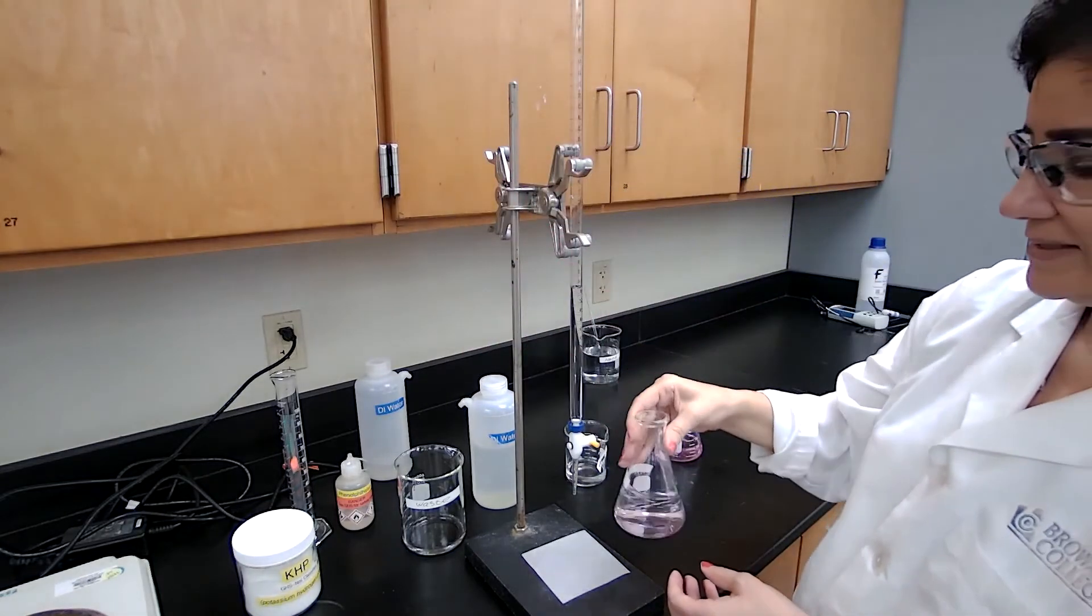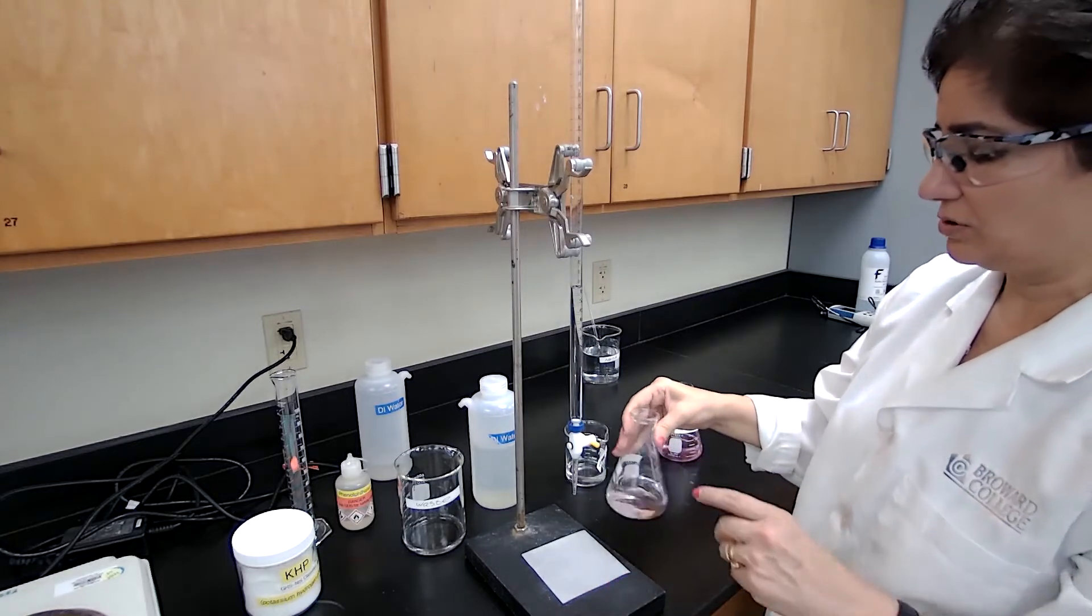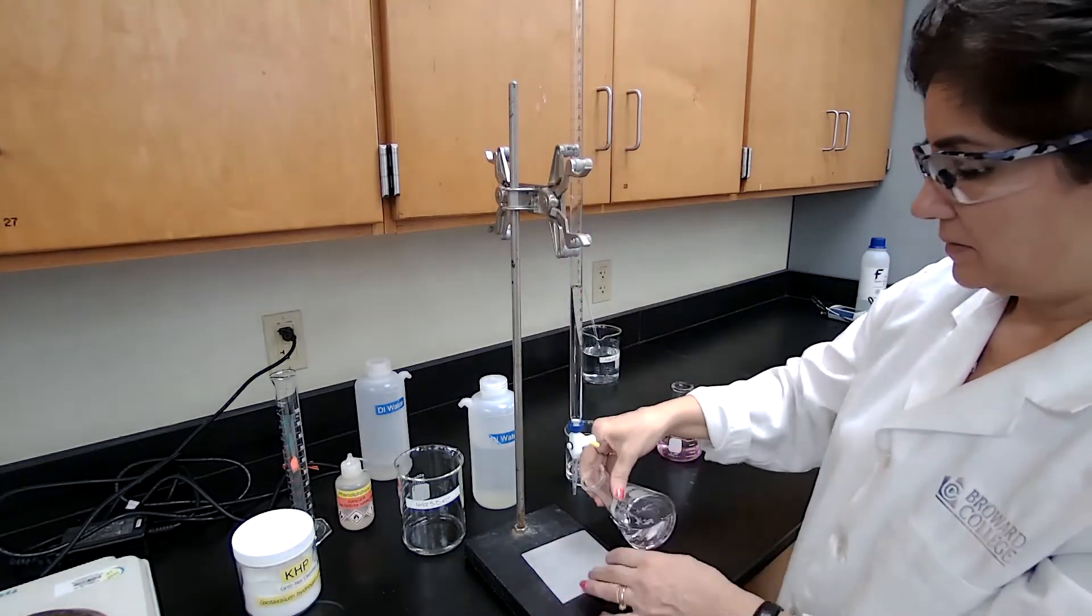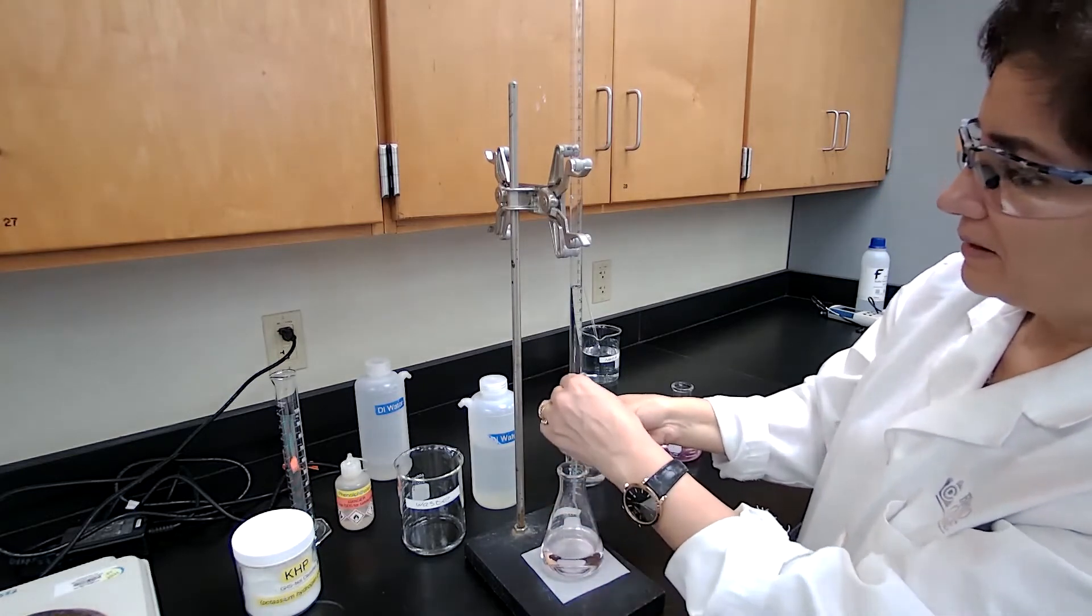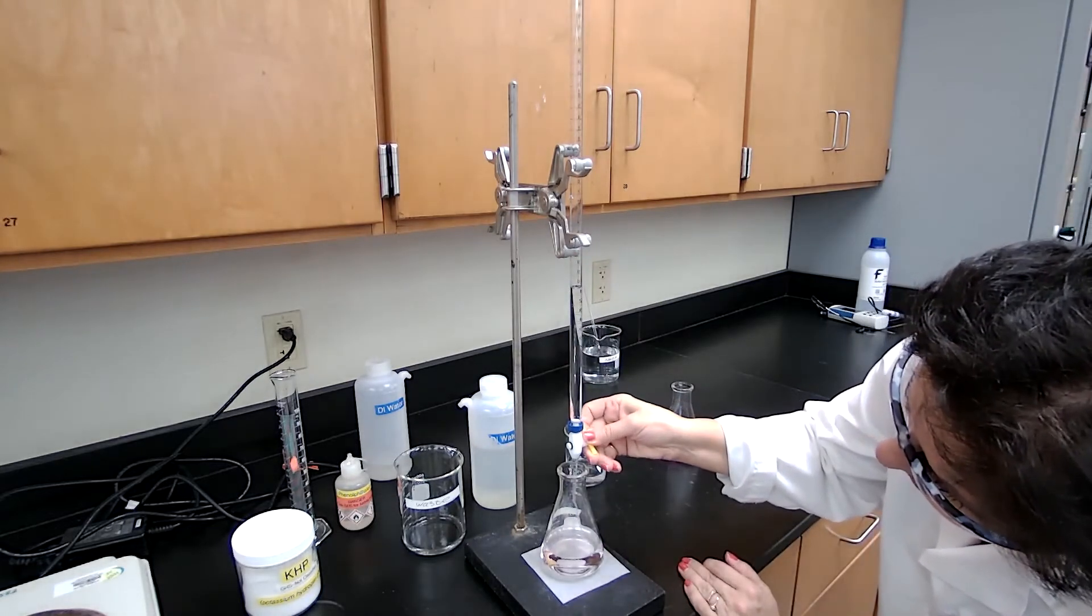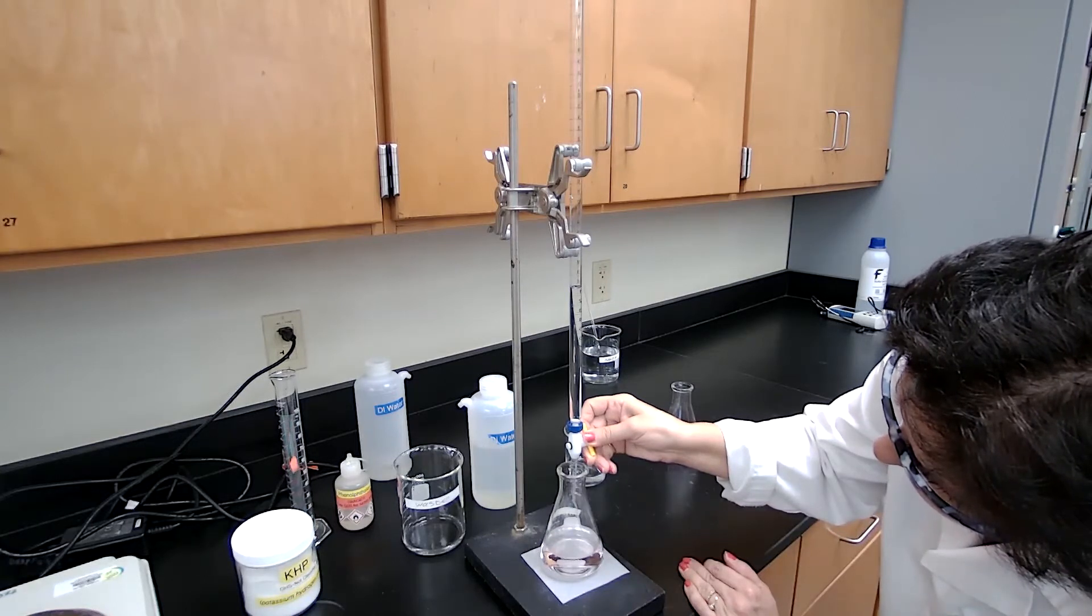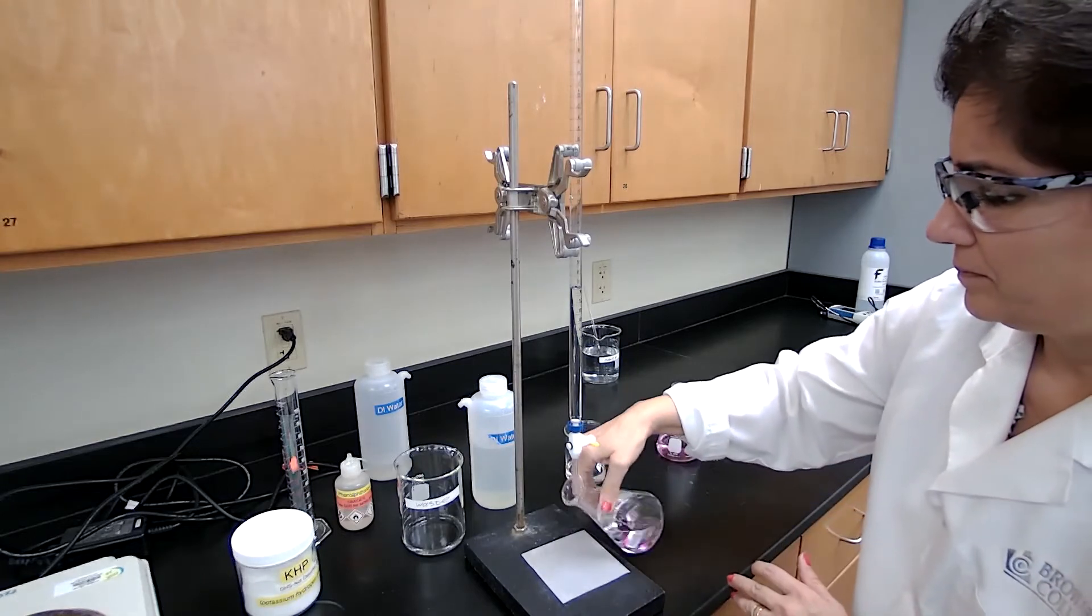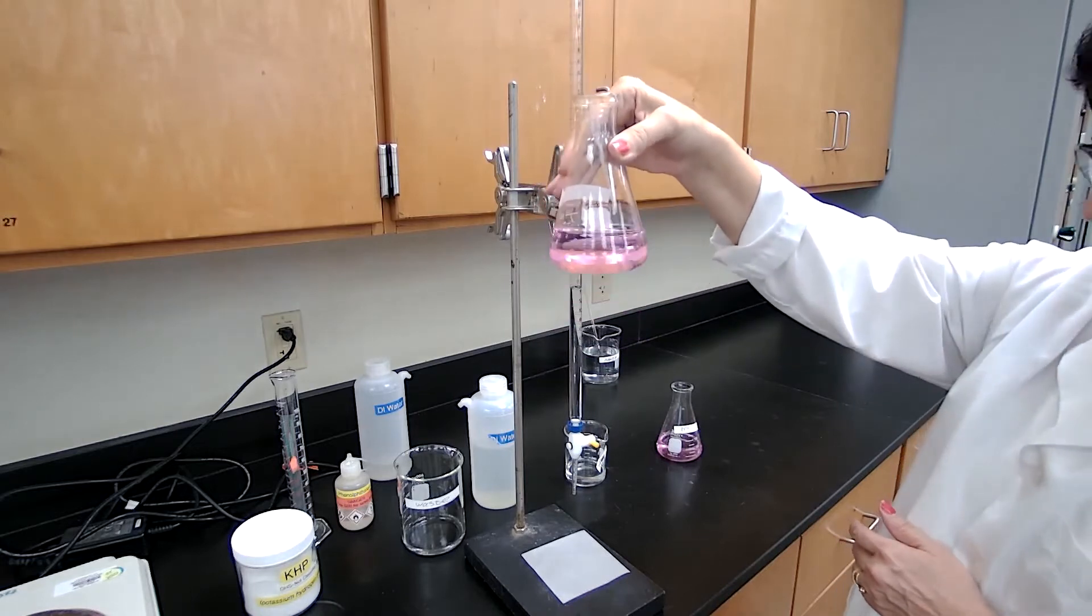And we have a light pink color. If it stays for 20 seconds, it's good. If not, I just add one additional drop of the base. It looks pink to me with the white background. But just to make sure that you could see the pink color, I'm going to add just one drop. And I have the pink color visible to everyone.